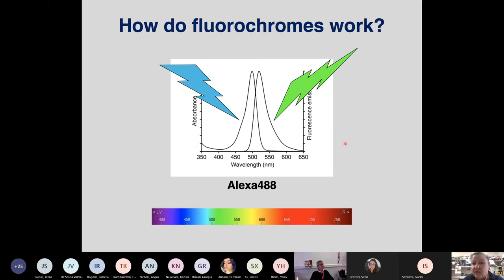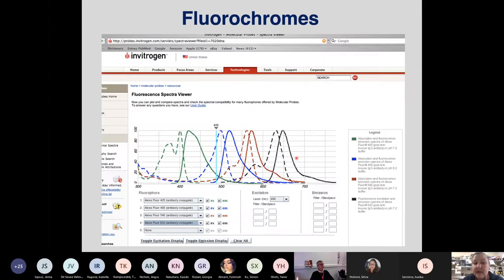Now this is not what fluorochromes always have. Because when you see here a comparison of four of these Alexas, in the different shades that work in combination, you can see, yes, the Alexa 488 has narrow peaks, but the other ones have bumps. And if these bumps overlap with the emission bump of some other fluorochrome you use, you may be having crosstalk between the fluorochromes, and again you may come to a misleading conclusion about co-localization and so on and so forth.